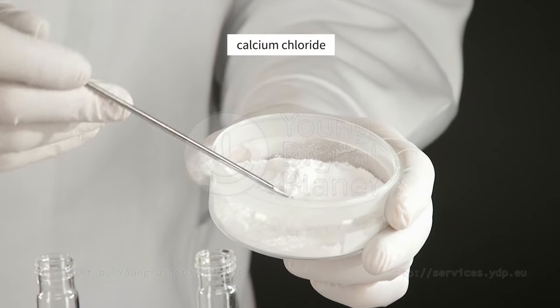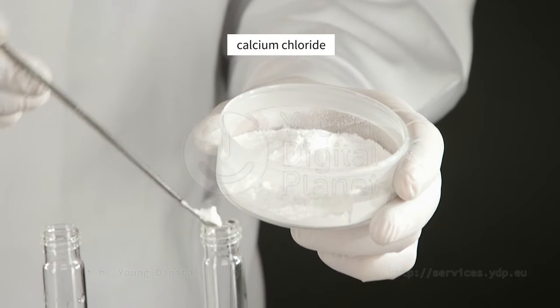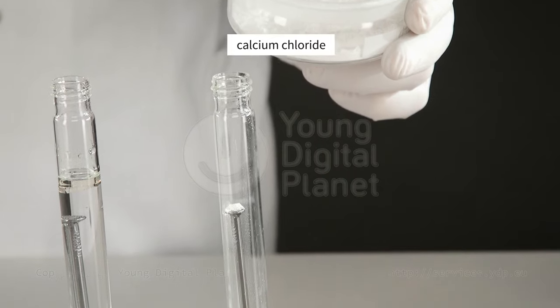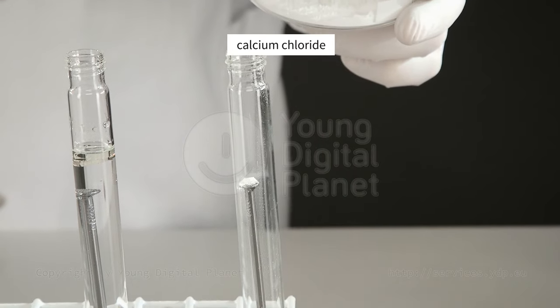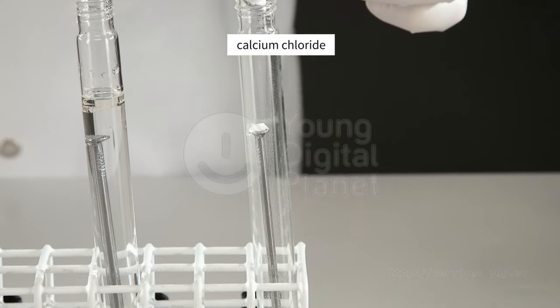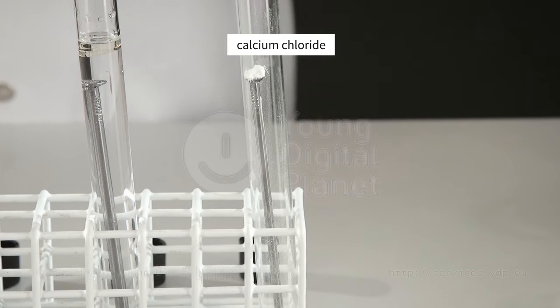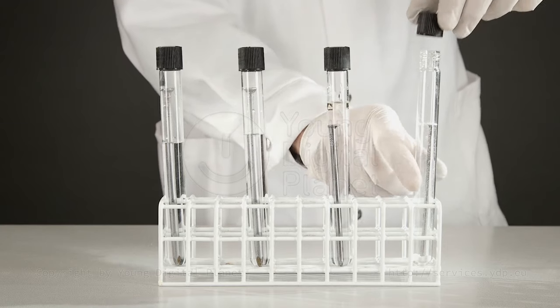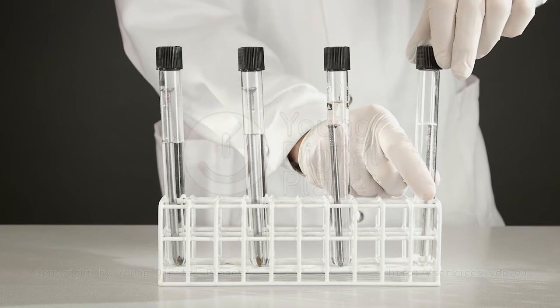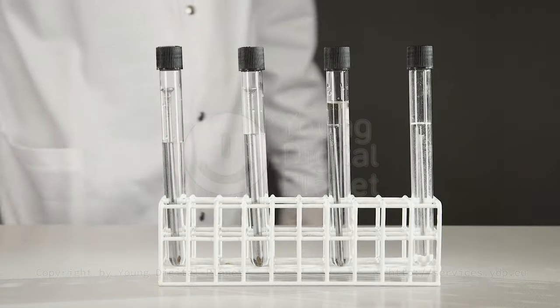We add calcium chloride, which will absorb the water vapor present in the air, to the fourth test tube. We seal the test tubes with stoppers and put the rack aside for a few days.